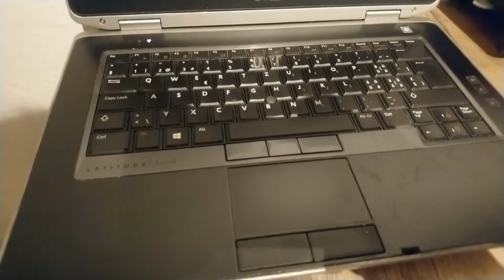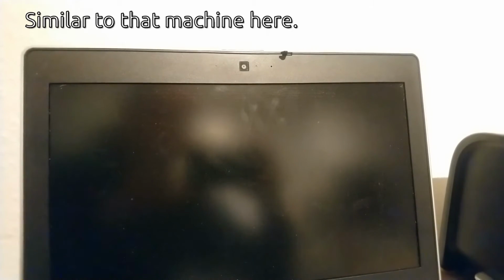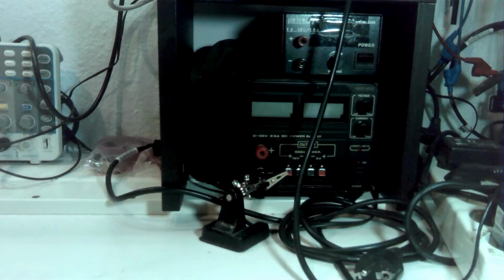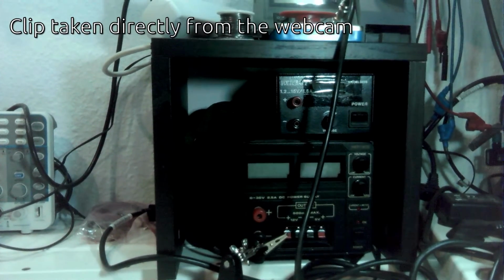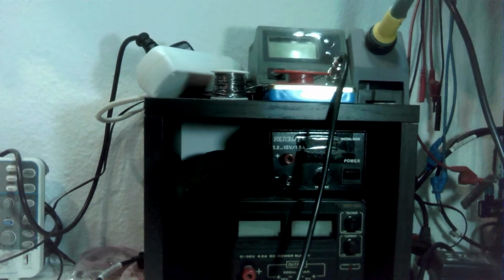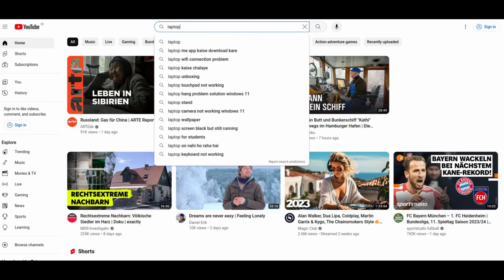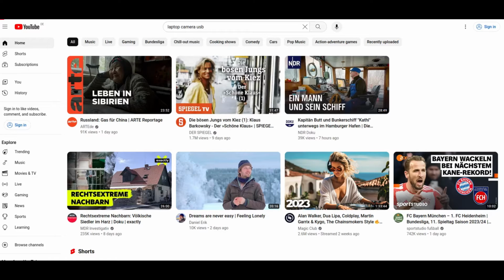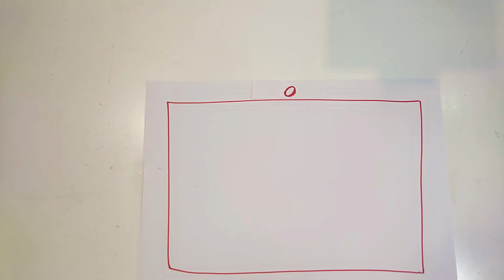For my project, I will use the camera from an old Dell laptop that has reached the end of its life. That camera has very decent picture quality for a webcam, as you can see here, and it has a surprisingly high resolution. There are enough videos on YouTube that show how to use laptop cameras as USB webcam. Here's a quick 1-minute summary.